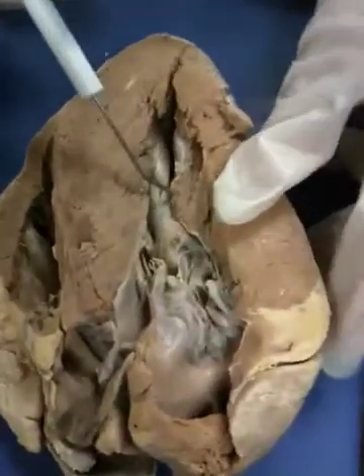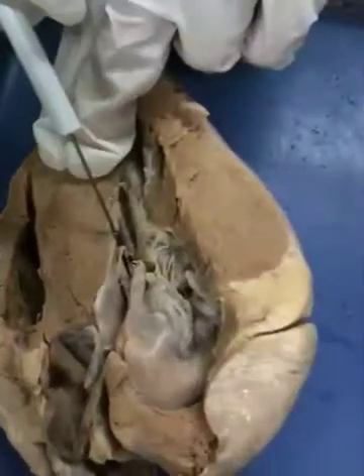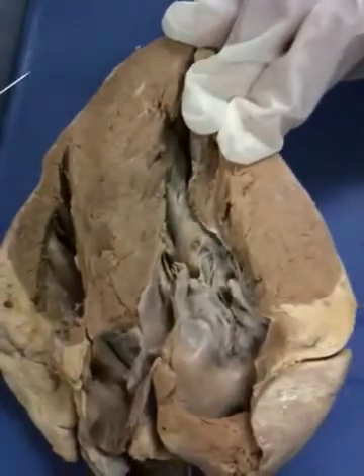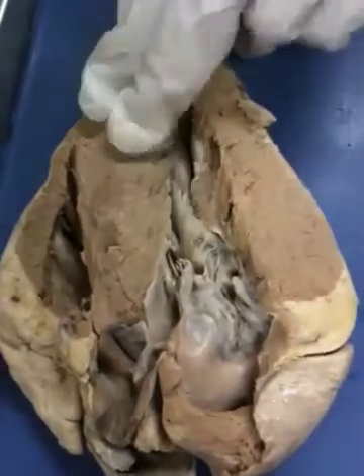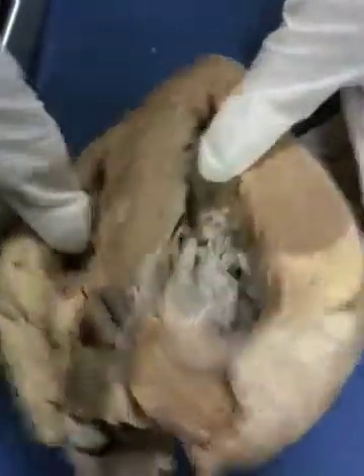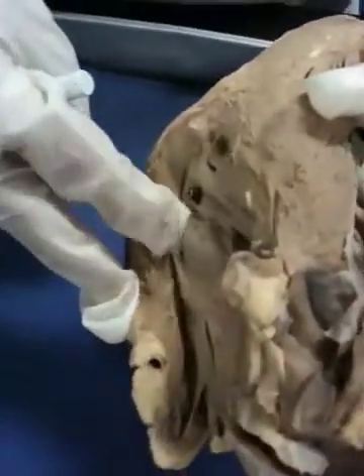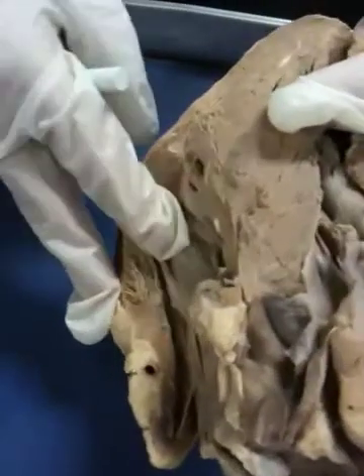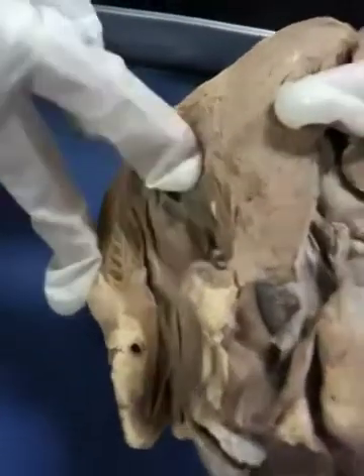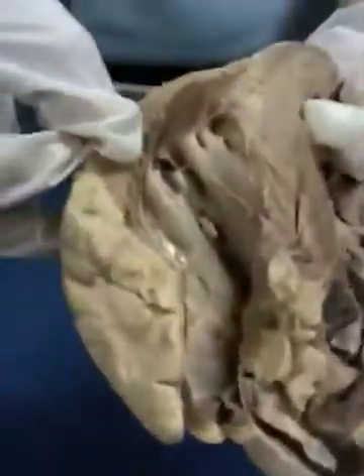Really on these sheep and pig hearts, we're only seeing two or three papillary muscles — and I'm not going to make you imagine a papillary muscle; it'll be a nice big one. The trabeculae — this is the right ventricle — look like tree trunks in the bottom part of the ventricle, but they don't project into the space of the ventricle; they just kind of line it. I'm not even sure you have to know trabeculae for the pig.